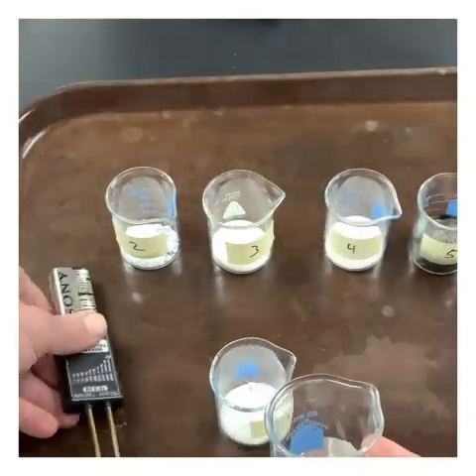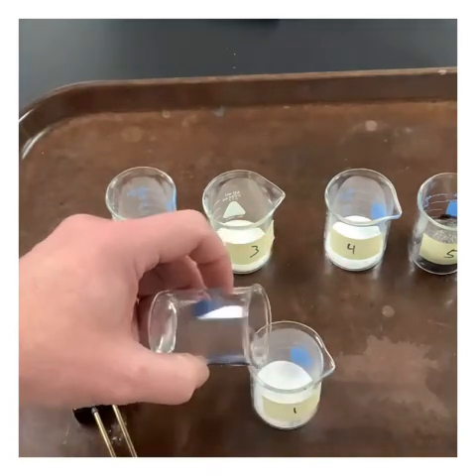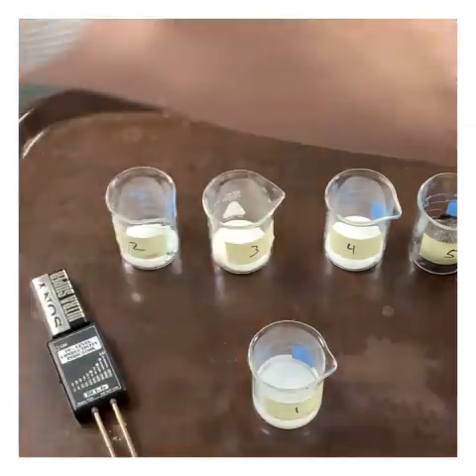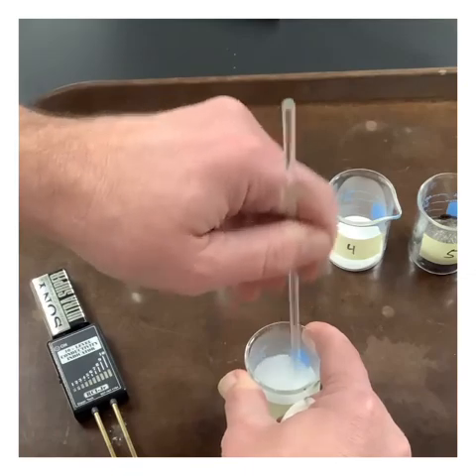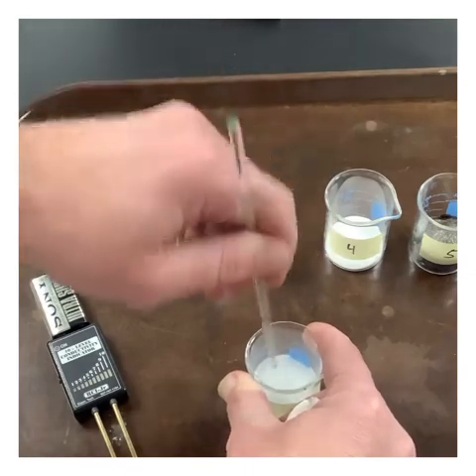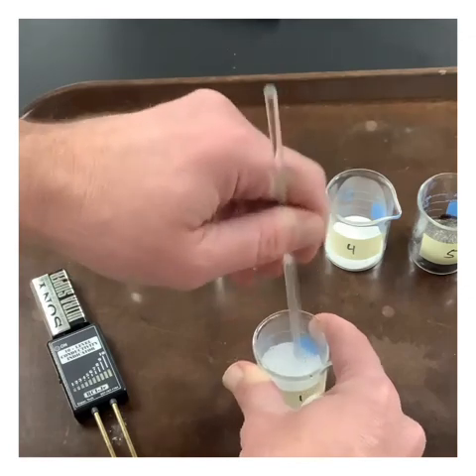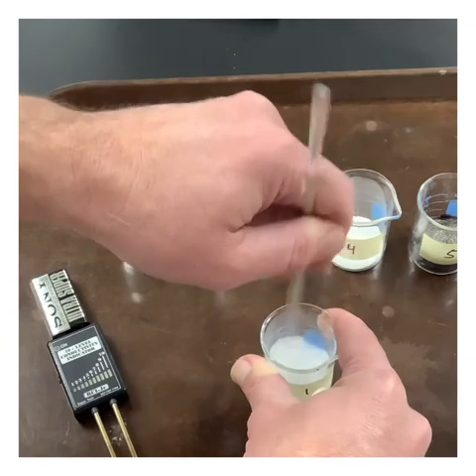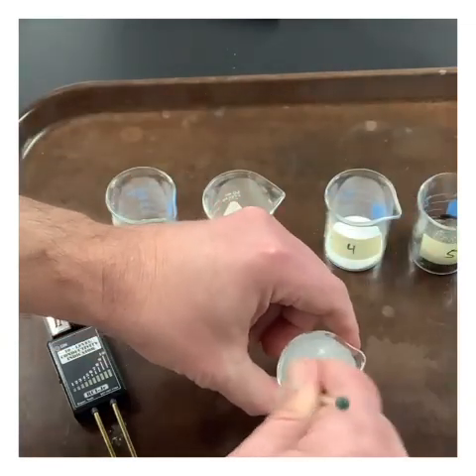Now what we want to do is see if this substance will dissolve and then conduct electricity. We're going to go ahead and just dump that water in there to save some. We'll give it a stir or two. Let it get a chance to dissolve, if it will dissolve even. It looks like some of it's going into solution.